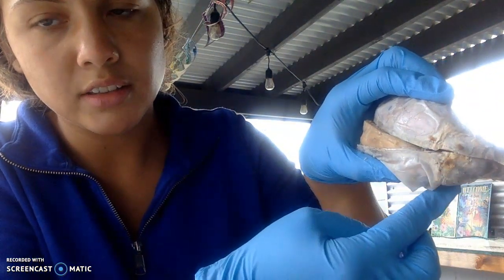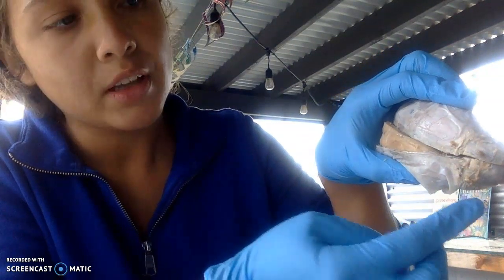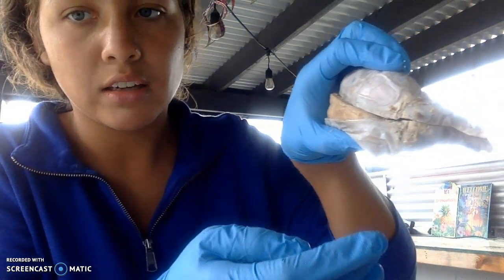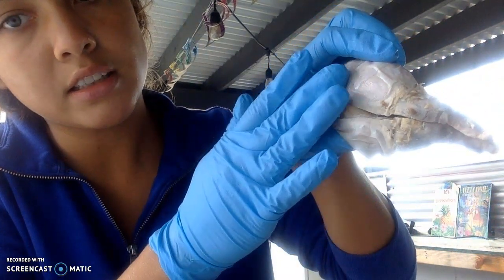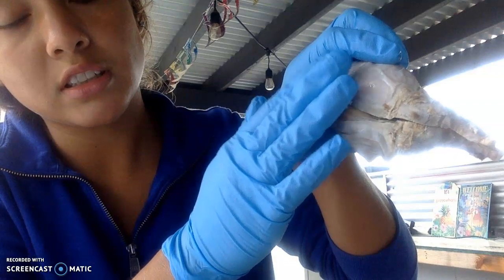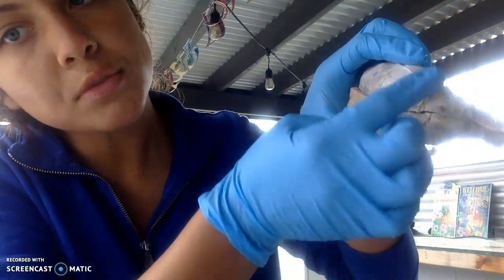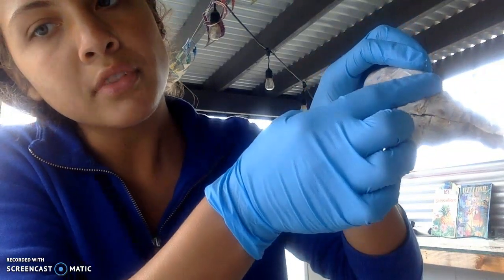It would be these two lines, or this line back here, that separates the forebrain from the hindbrain. And I didn't cut it, but you can kind of see this is the hemispheres, and then the hindbrain is back here, and the transverse line would just be right here. Okay. And then corpus callosum, that is this.